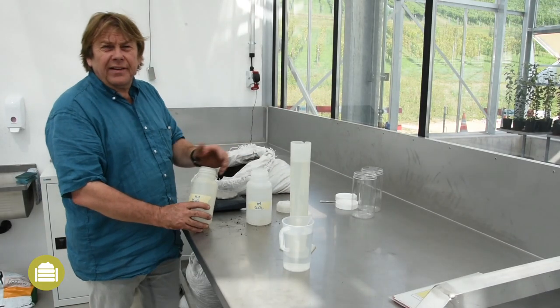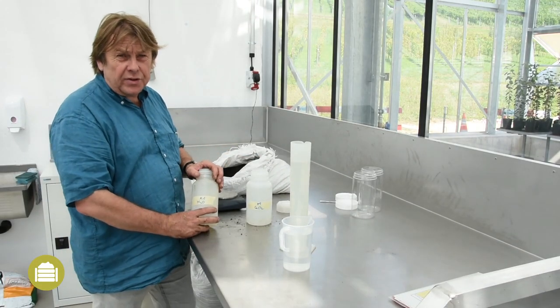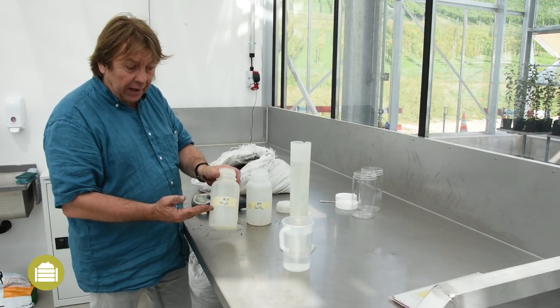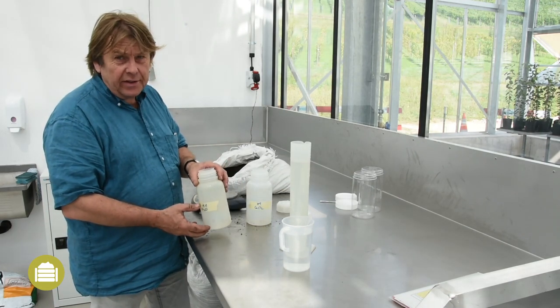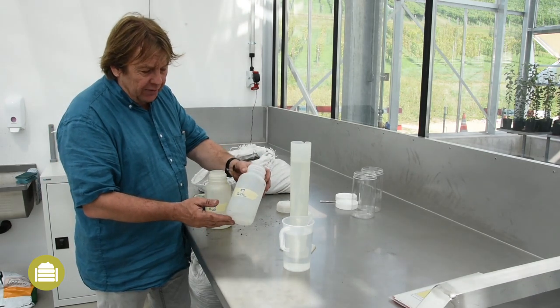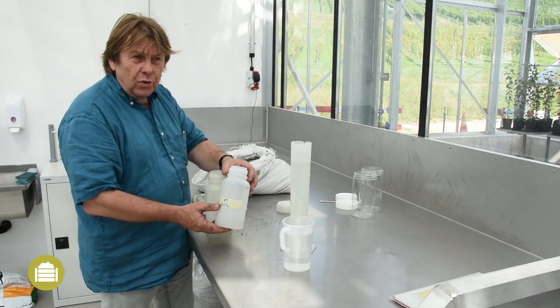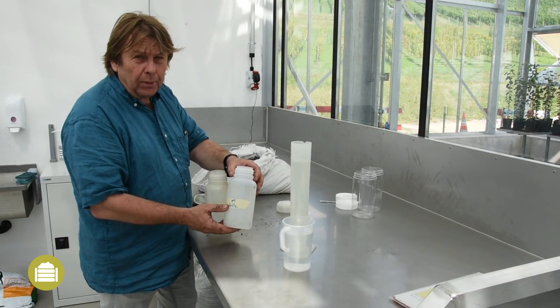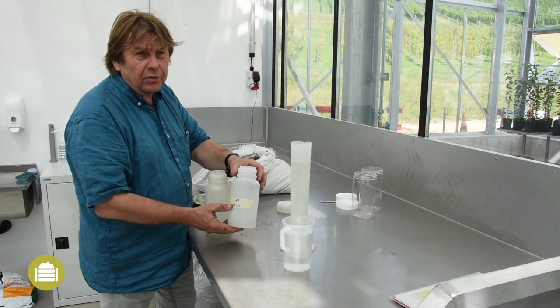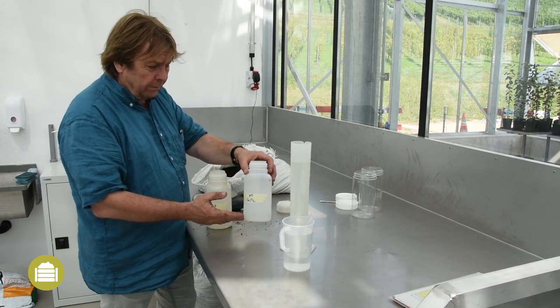For the simple chemical analysis I will make two extractions. The first one is with water to measure the salinity of the compost. The second extraction is made with calcium chloride for the measurements of pH and the quantities of mineral nitrogen — ammonium, nitrite and nitrate — in the compost.